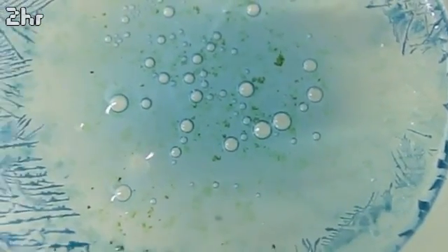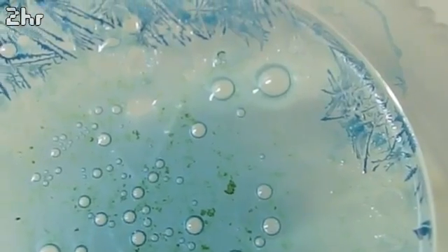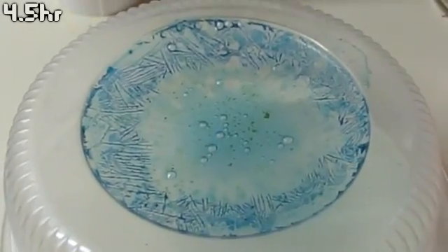They have been there forever. They are very resilient to poppage. I don't know why. Okay, here we are at about four and a half hours of crystal growth.